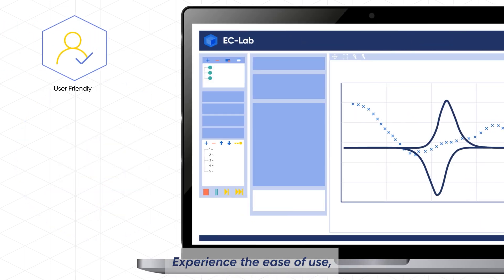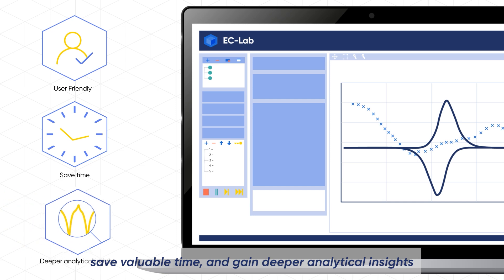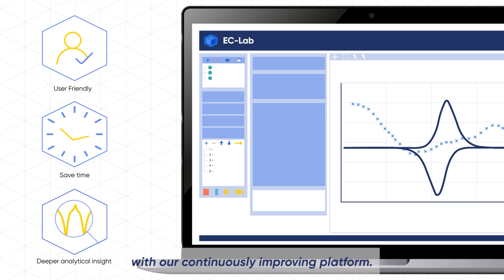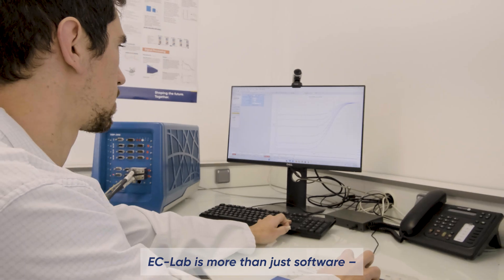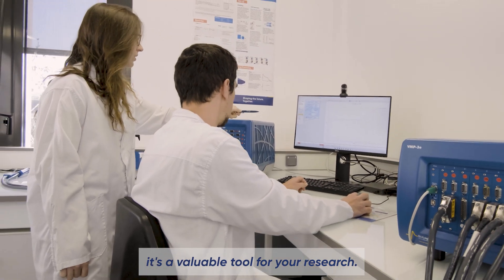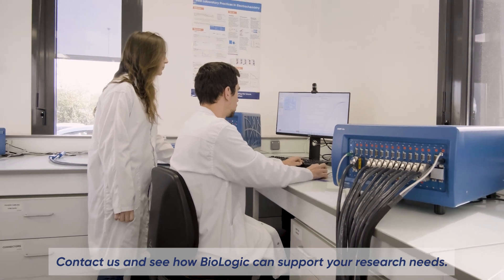Experience the ease of use, save valuable time, and gain a deeper analytical insight with our continuously improving platform. EC Lab is more than just software, it's a valuable tool for your research. Contact us and see how Biologic can support your research needs.